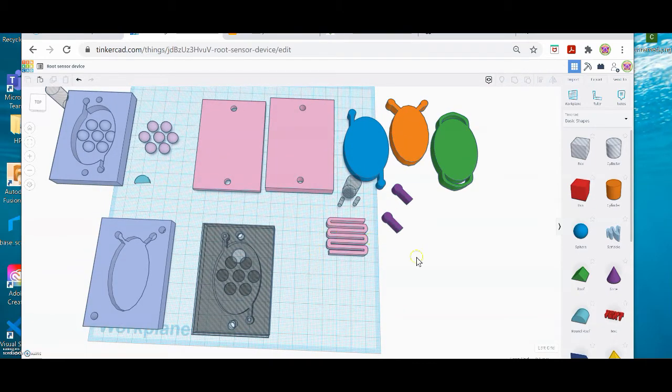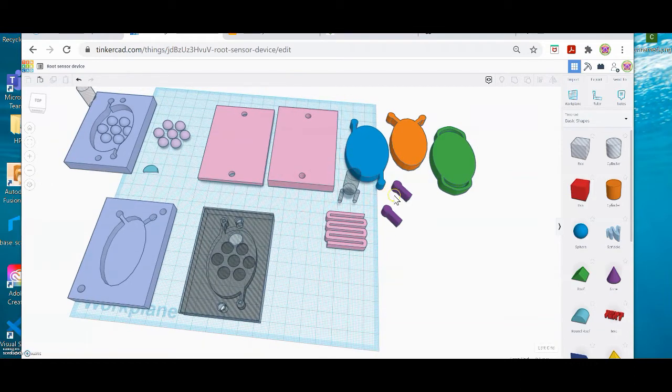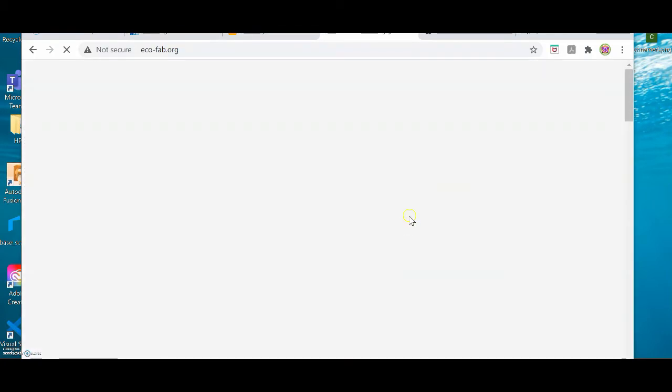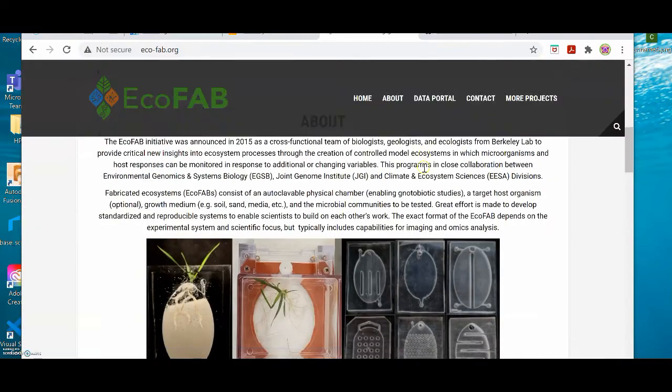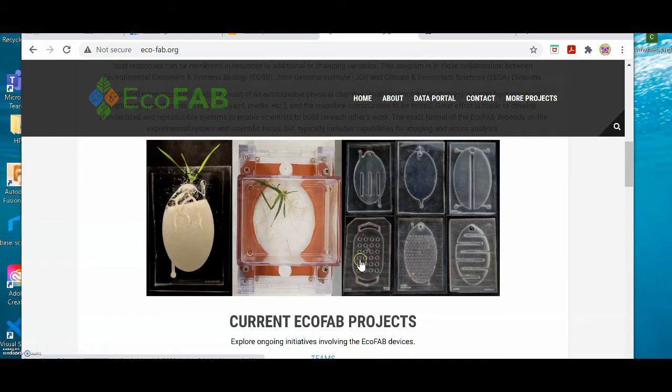Okay, so let's start from the beginning. So when you open up this file, you're going to be working with these two pink pieces. And the very first thing you want to figure out is what is that shape you want to have at the bottom. So let me show you this again on this home page. Here's some examples of their designs, and you can see there's different shapes. Well, they're all oval here actually, but they have different shapes within that, and they have different numbers of feeder ports, and then there's a little hole for planting the seed.